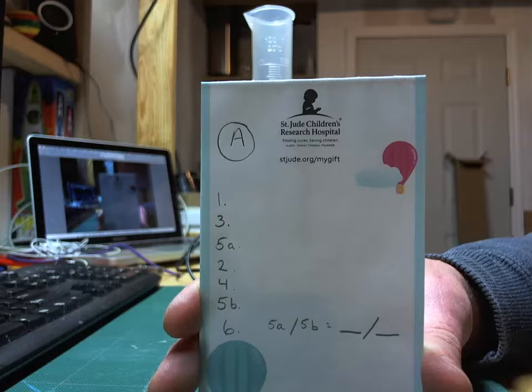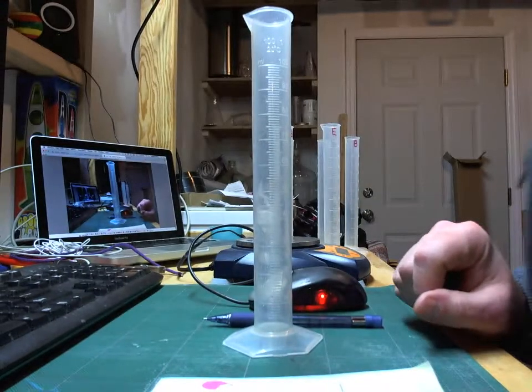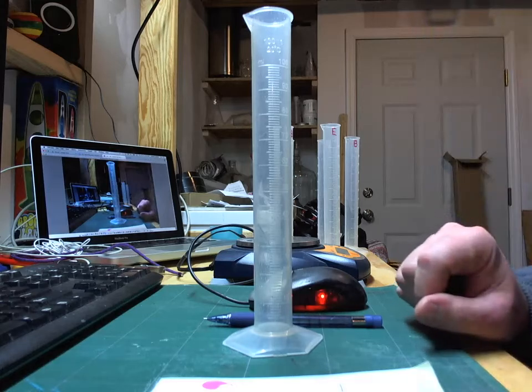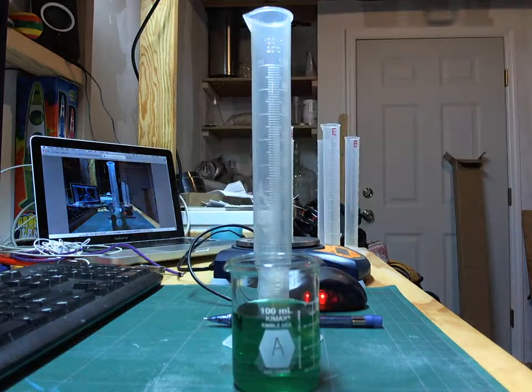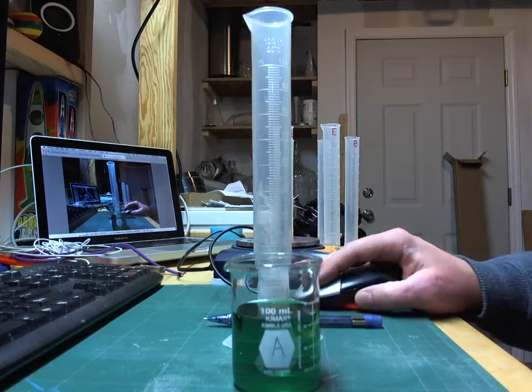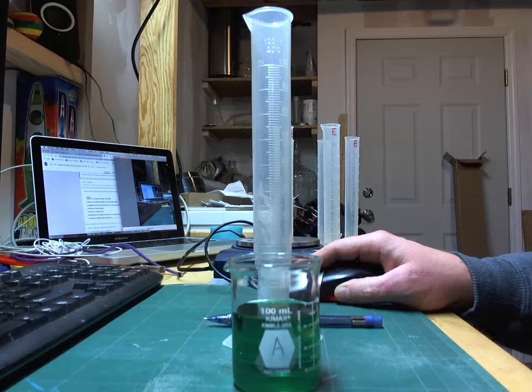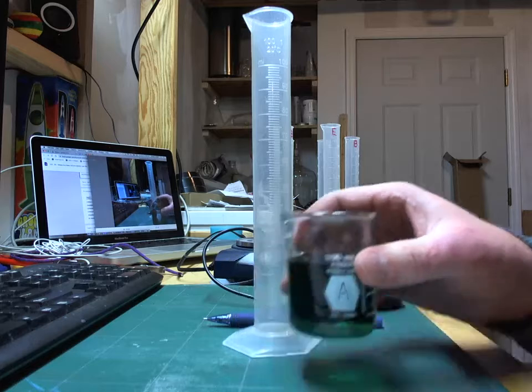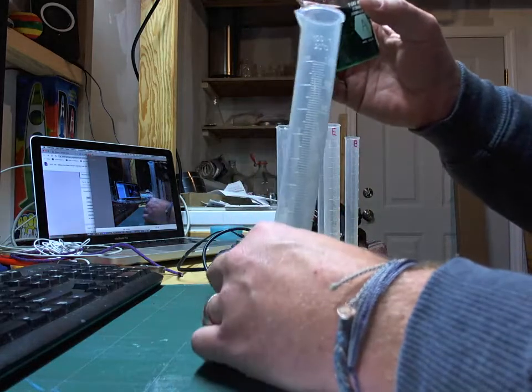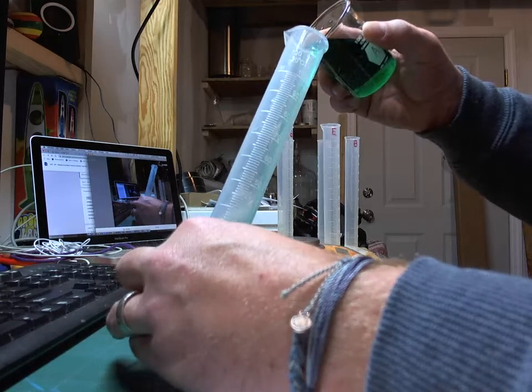Okay, so let's get started with liquid A. I have my recording here, and liquid A is a little bit funky. This is liquid A. We're going to start off following the chart, and the chart has us looking at the mass of the graduated cylinder and fluid. So I'm just going to pour a little bit of this fluid into this graduated cylinder here. It doesn't matter how much, just as long as I pour some to get a first reading, because that's the important part.